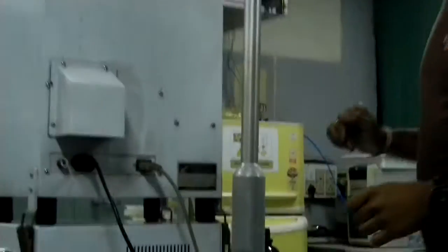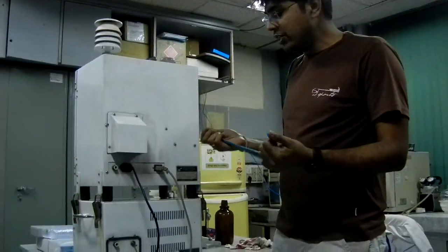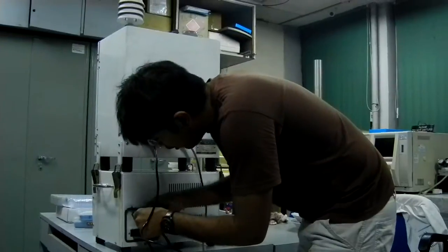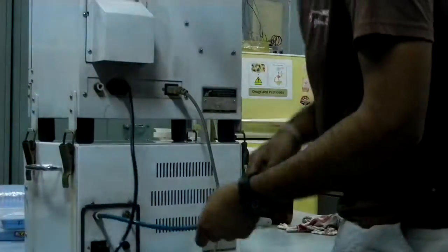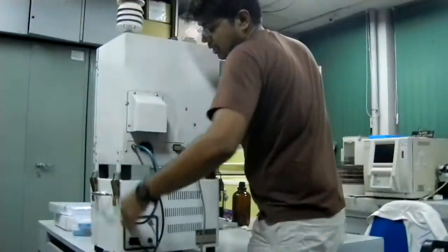The main power supply should go directly into the control unit. We have a tube which will provide the suction from the pump to the control unit. This is a push-button mechanism — we just push it, then insert it, then release it. That's it — it should be fixed.